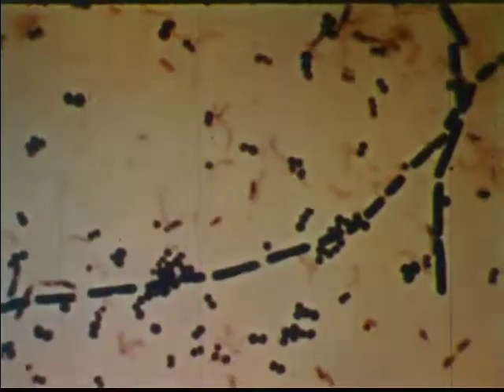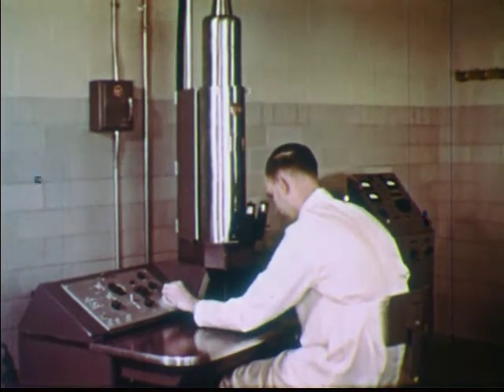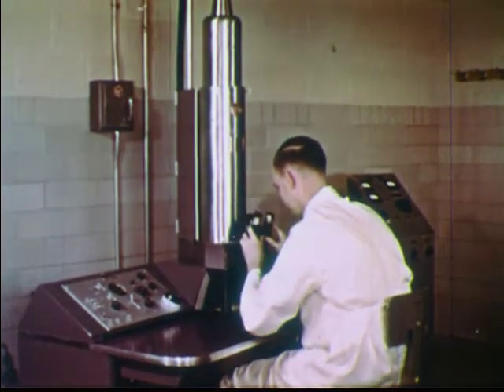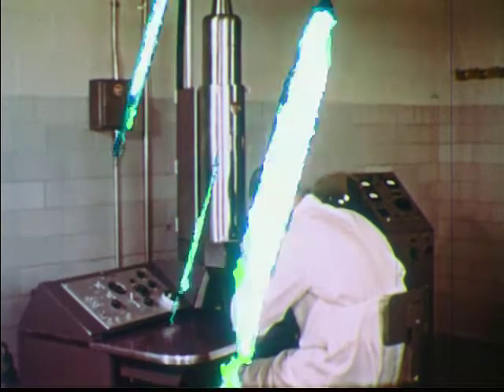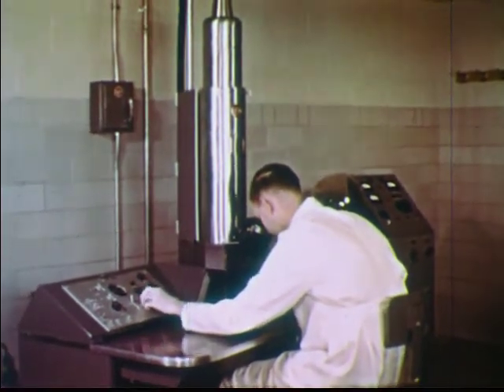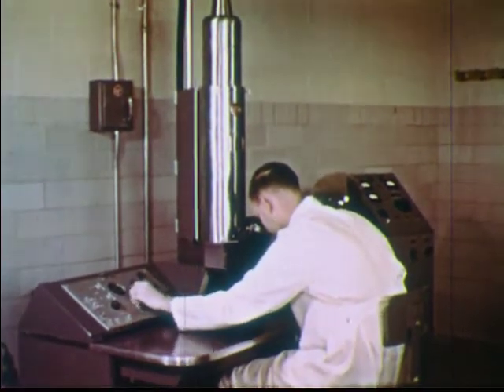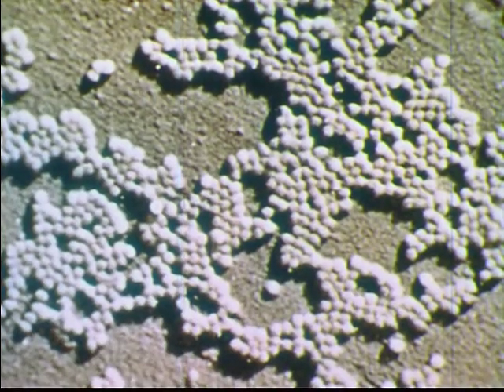While magnification approaching 1,000 times is used to study this microscopic world, an electron microscope capable of magnifying many thousands of times reveals living things even smaller than bacteria. These are viruses, the smallest known forms of life.